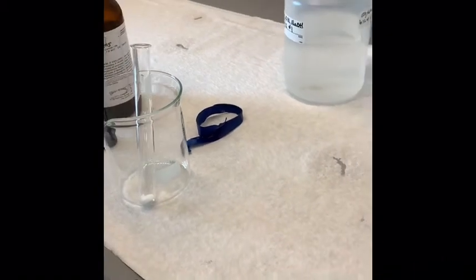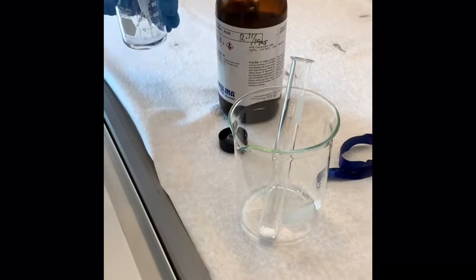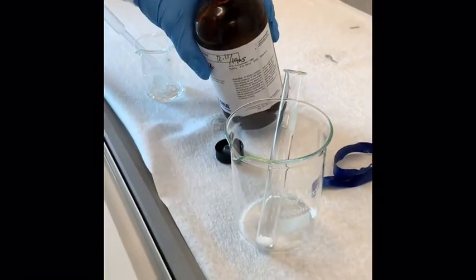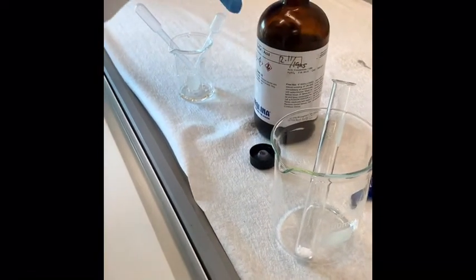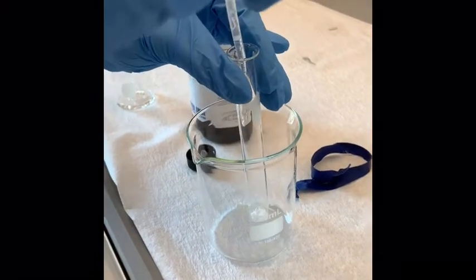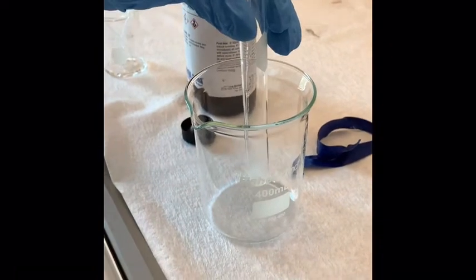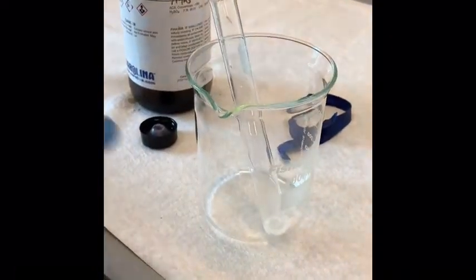I'm going to try again on that. If it's a little bit more, that's okay, because it's in excess. So we're adding half a milliliter, maybe a little bit more, to our test tube with our oxime. Then we're going to take that over to our hot bath and let it react for 15 minutes.